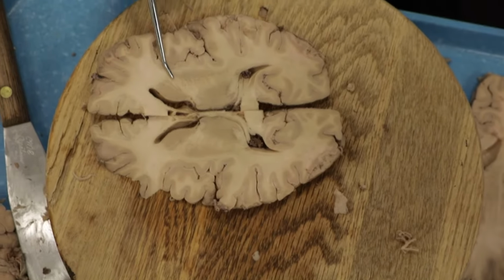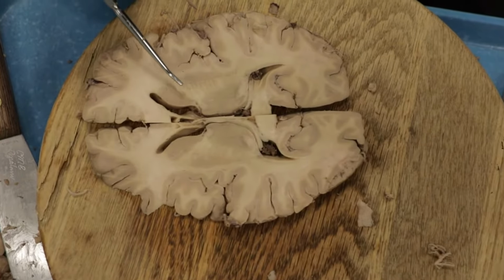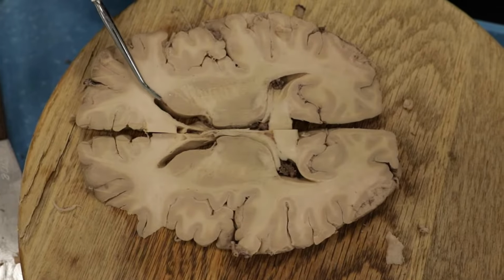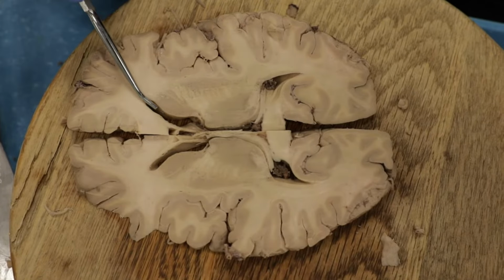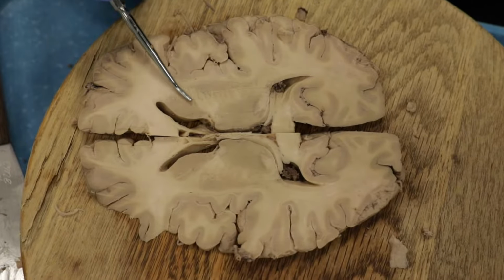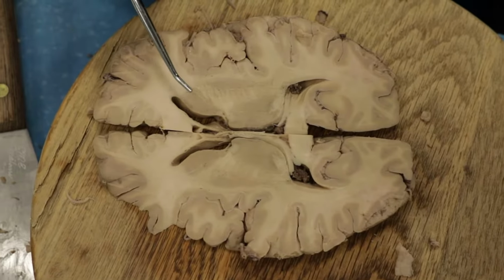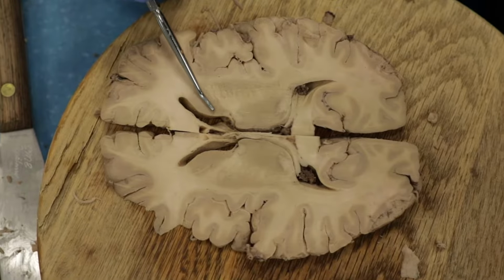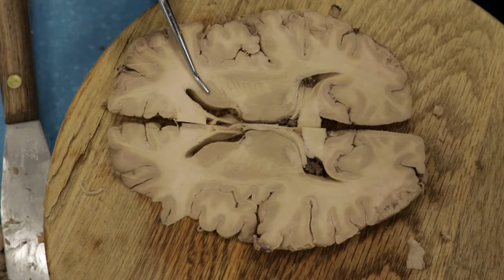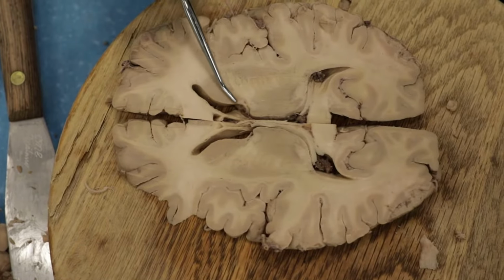So we want to identify what is medial and what is lateral to the internal capsule. Medial to the anterior limb is the caudate nucleus. Here again we see it bulging into the lateral ventricle. The caudate nucleus is part of basal ganglia circuitry, very important for movement. Probably the most common condition we'll talk about that involves the caudate nucleus is Huntington's disease. These patients have a very profound movement disorder. They have chorea, they have uncontrollable movements.